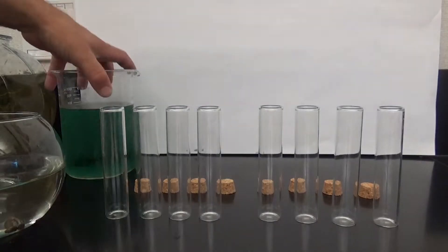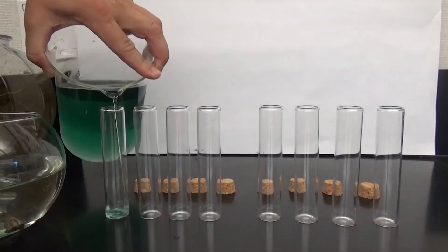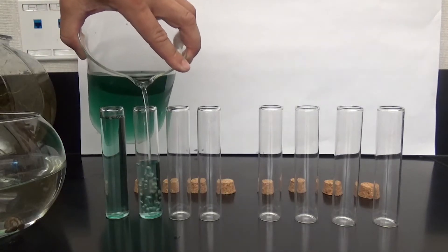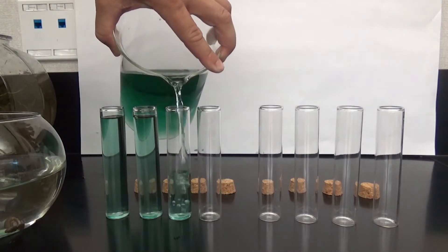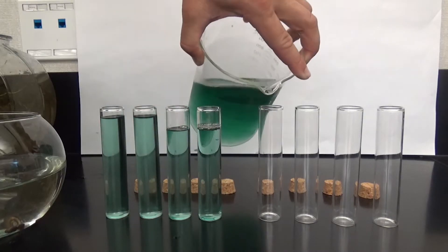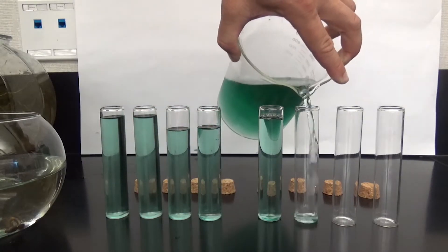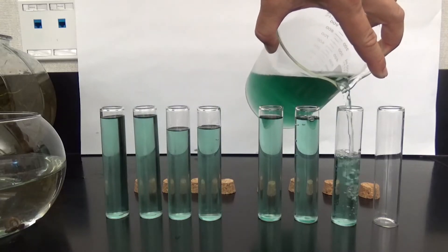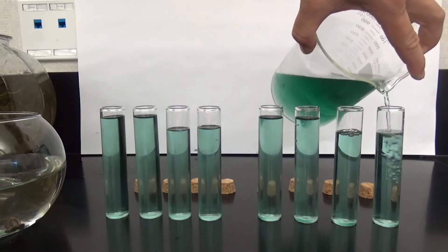You're going to start off by grabbing eight test tubes and filling them with a solution of bromothymol blue. This solution is also called BTB and is an indicator of carbon dioxide. When it is blue it indicates no or low CO2 levels. When it changes color to green or yellow it indicates high levels of CO2.